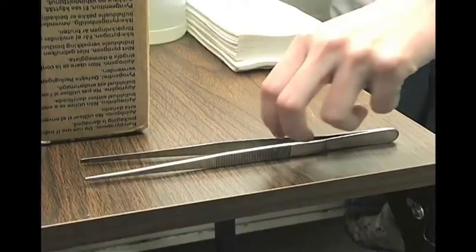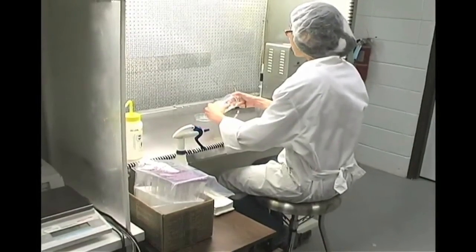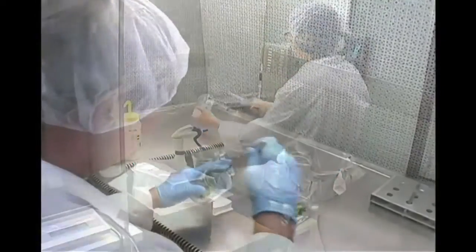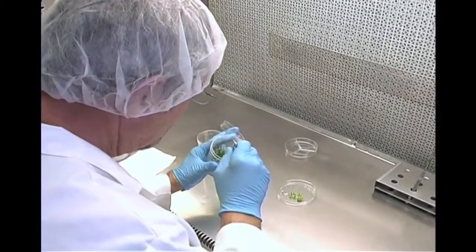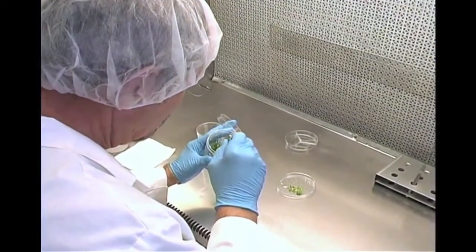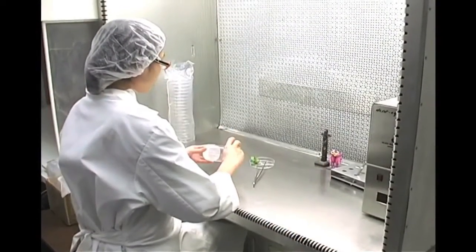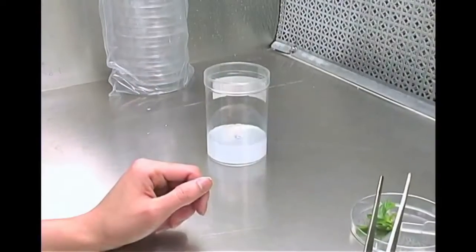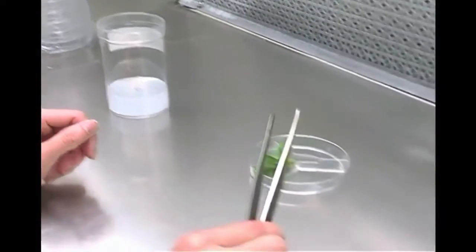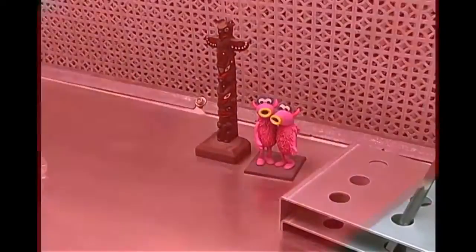Do not pass non-sterile items over sterile areas or items. Reach around rather than over. Make your movements smooth so that you do not disturb the air more than is necessary. Work quickly though. The longer it takes to manipulate the tissues, the greater the chance of contamination. Have only the necessary items in the sterile work area. Remove items that are no longer needed as quickly as possible. Think about each step before beginning so that you understand what you are about to do.